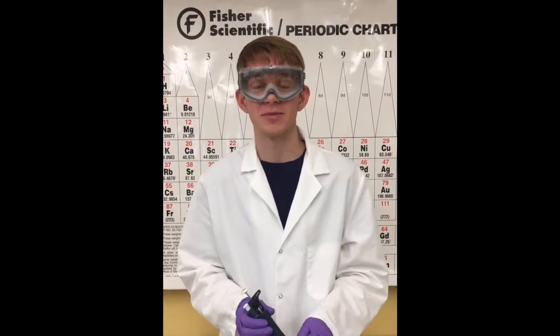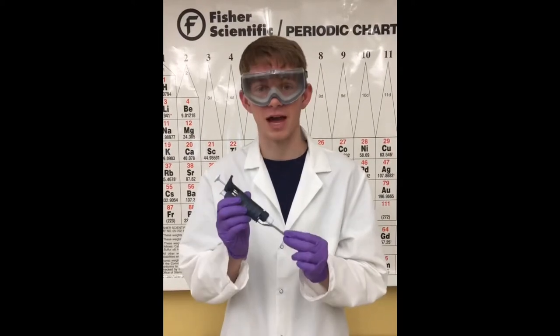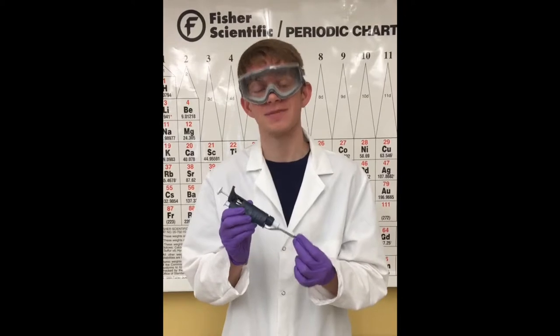Hi, my name is Michael Walz, a biochemistry major at Cal Poly Class of 2018, and today we will be talking about how to properly use a micropipet. Let's get started.